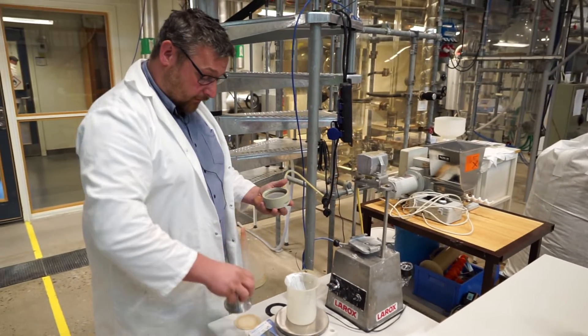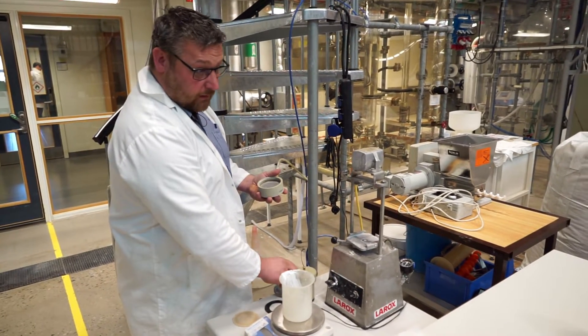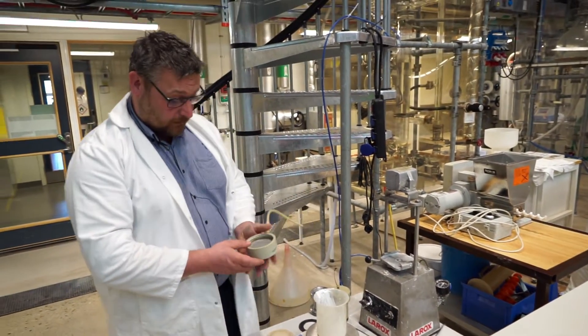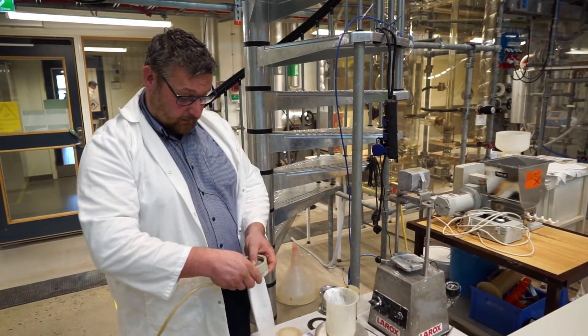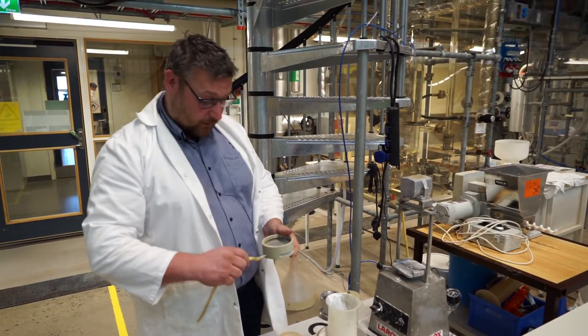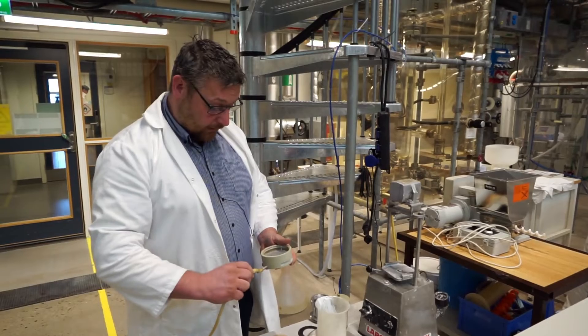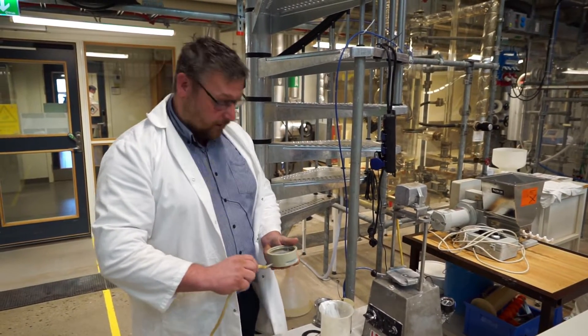And for this demonstration we're going to use calcium carbonate, ordinary garden quality, and see if we can get some kind of filtration from it.